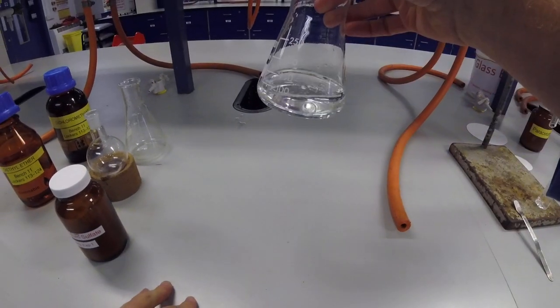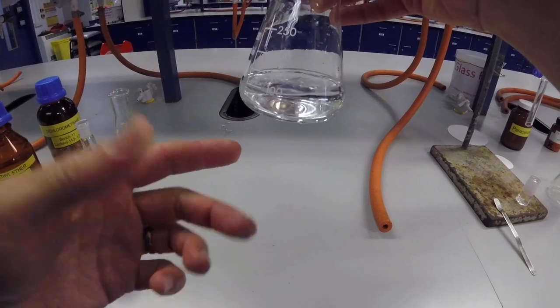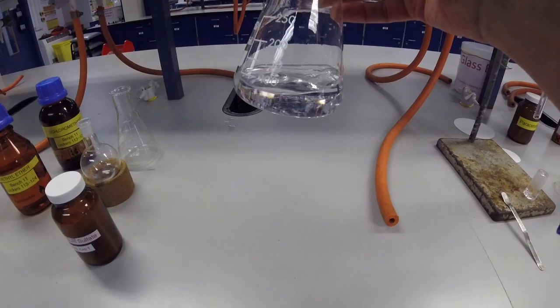So we've carried out our separation, and now we've got our solvent that hopefully contains our product. It may contain a few impurities as well, and we're going to need to remove the solvent.